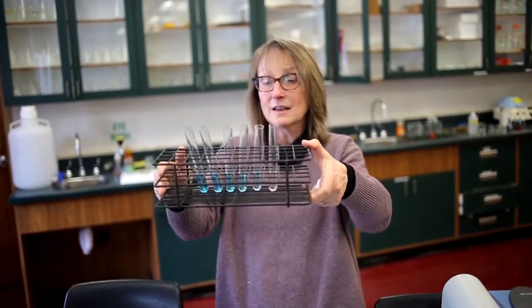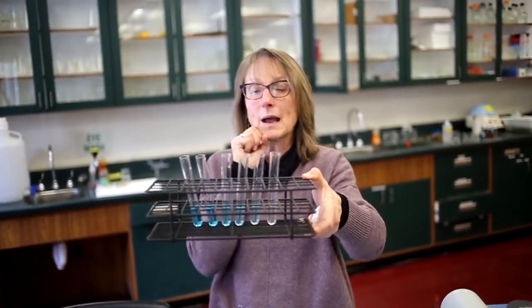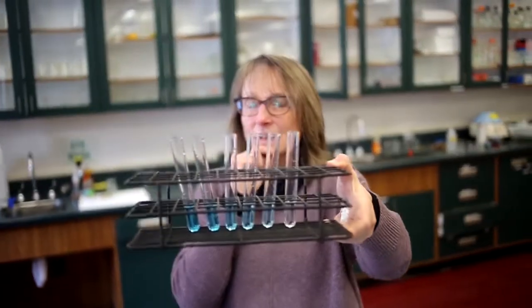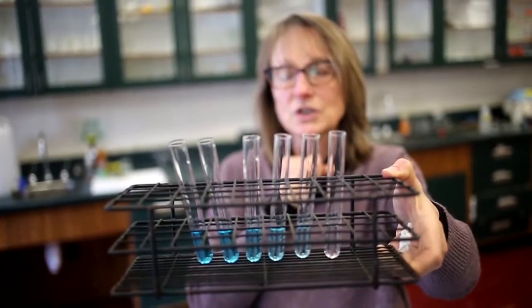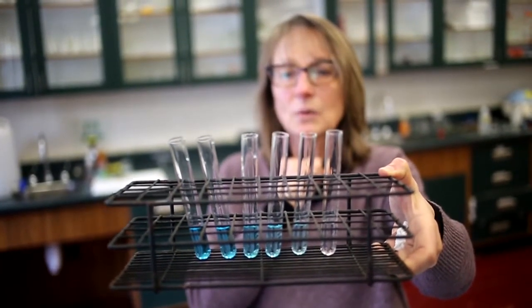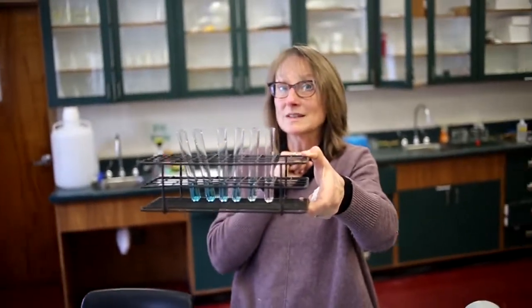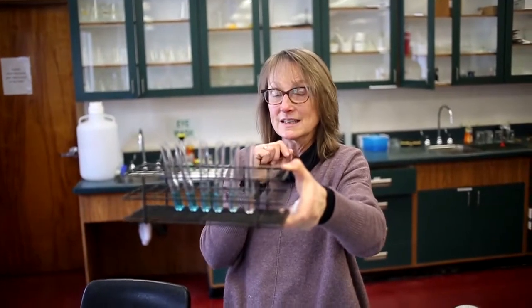So looking at these, if I mix these up, would I be able to put them back in order, going from the least concentrated to the most? They look kind of the same to me, even though I know there's different concentrations in each tube. And so I think we're going to have to use the instrument, which I hope is more sensitive than my eyes at discerning the different intensities of color.